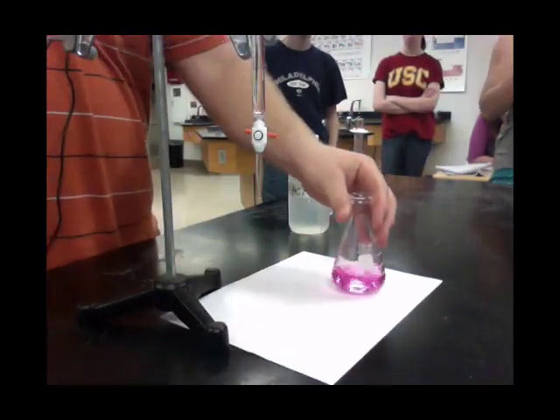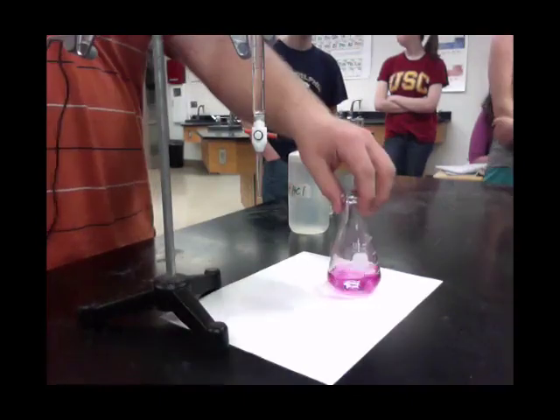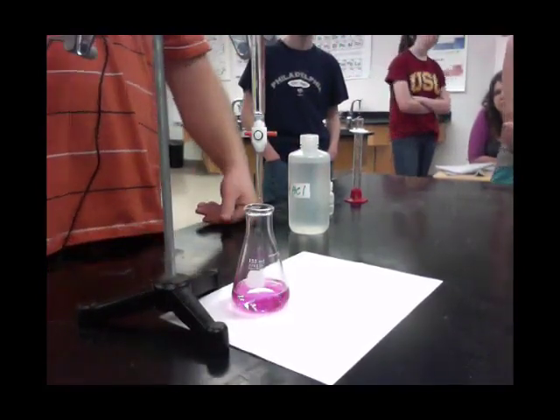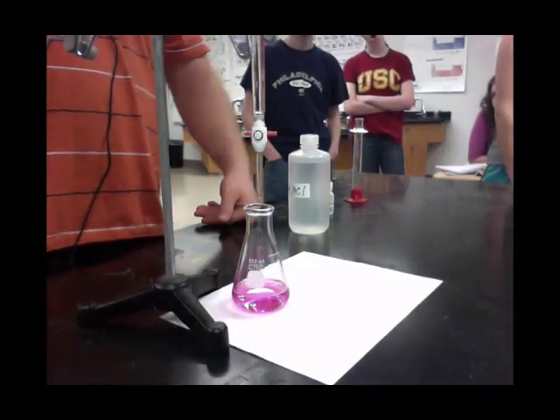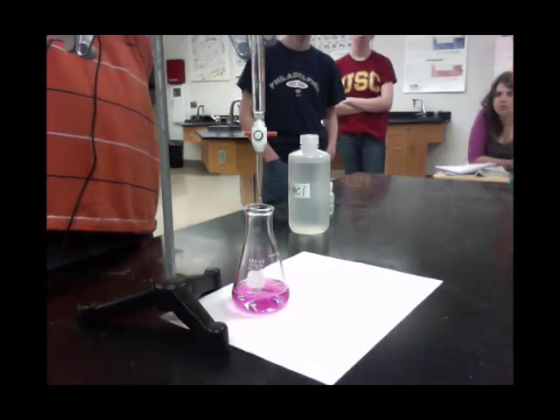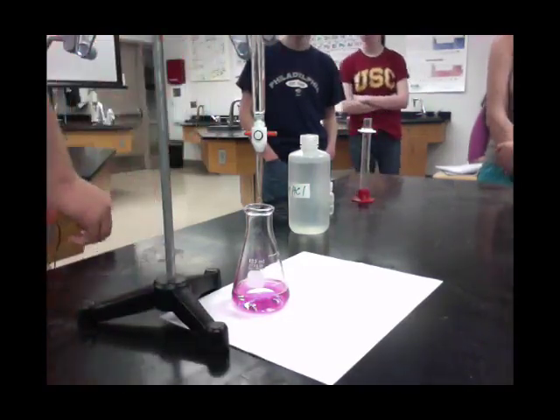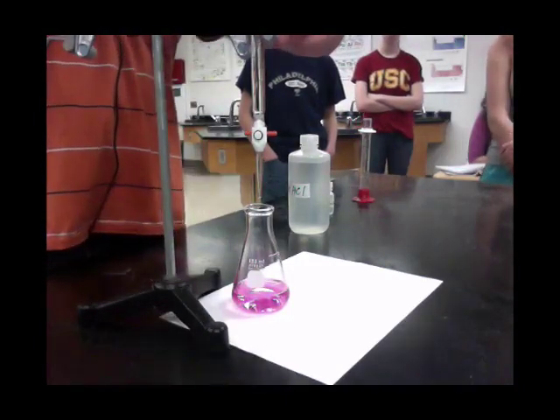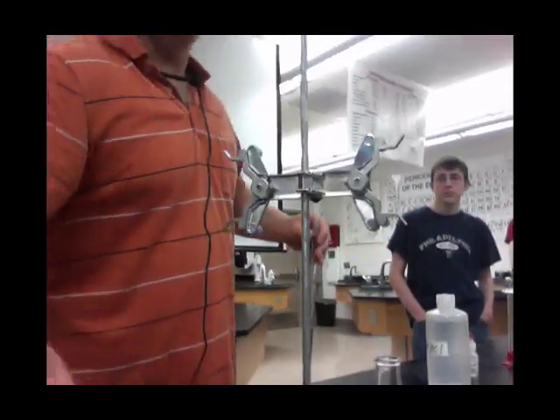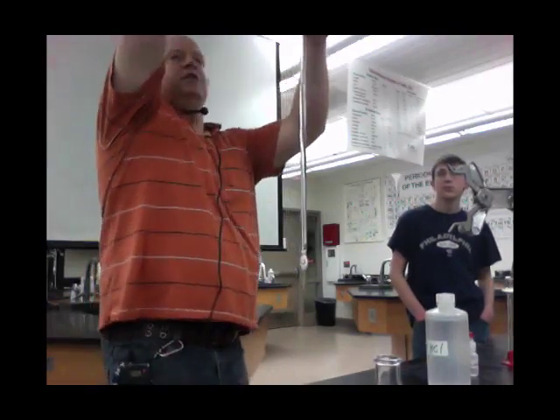When you're all done, clean and rinse the burette. Rinsing off the tip — you don't need to do that in our actual experiments. You can do another trial. If you ever need to refill your burette, be careful — it's only 50 milliliters, only twice a 25 mL cylinder. A lot of times people start to pour and overfill because they don't realize how little volume is really inside. Always use a funnel when you fill these, and take them out of their stands — bring the burette down so it's comfortable. Don't be reaching way up trying to refill.